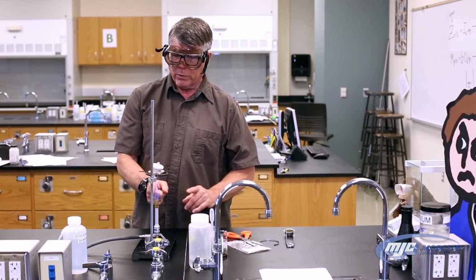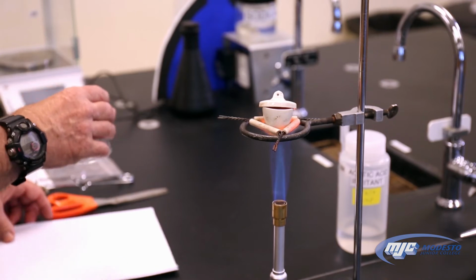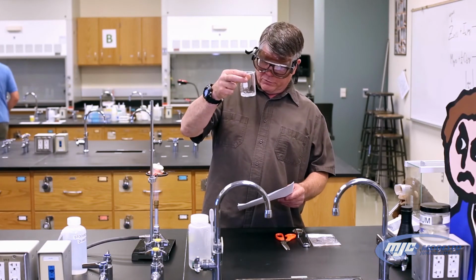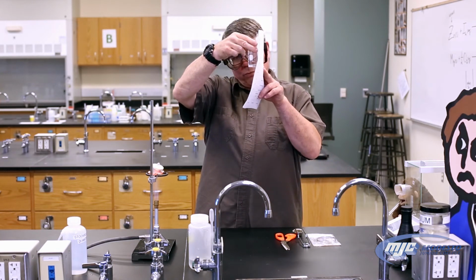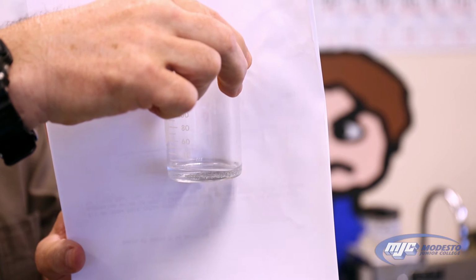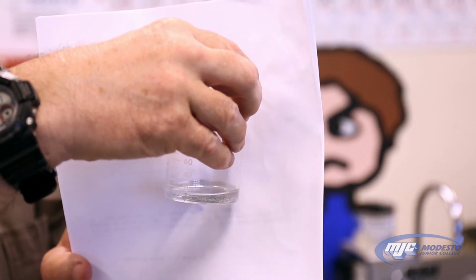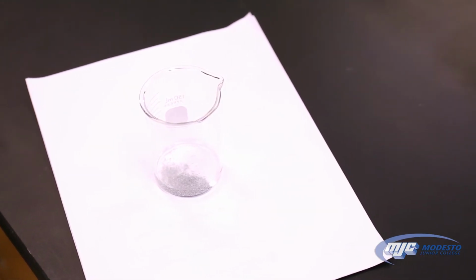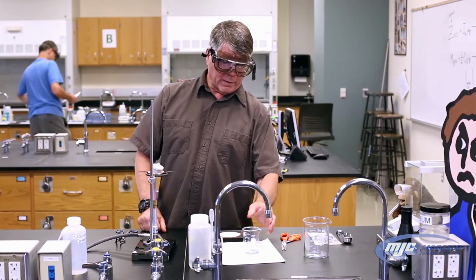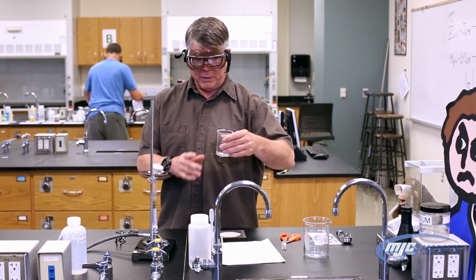And so now that we've got this going, we can come back over here and check on the zinc iodide. All right, guys, so checking back in on the zinc iodide, looks like it's pretty much all reacted. If we hold a piece of white paper up in back of it and look through that solution, we can't see any yellow, no red. So that means that all of the iodine has reacted with the zinc, and if you can see, there's still some excess zinc in the bottom, and we're going to end up weighing that eventually. All right, guys, so now that all the iodine is reacted, we can go on to the next stage where we decant and wash this.